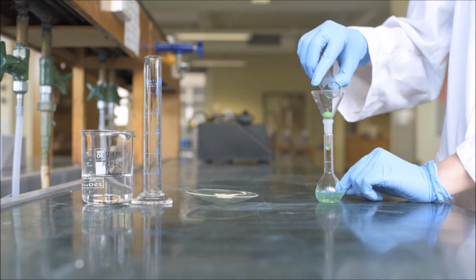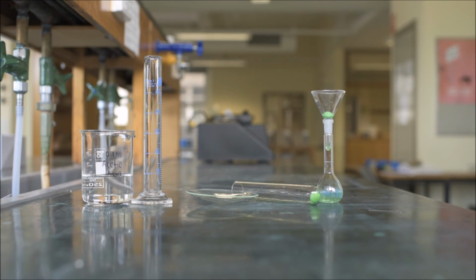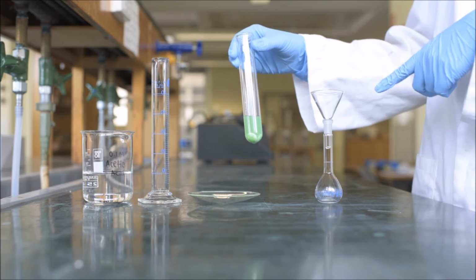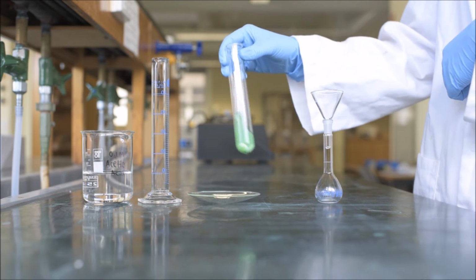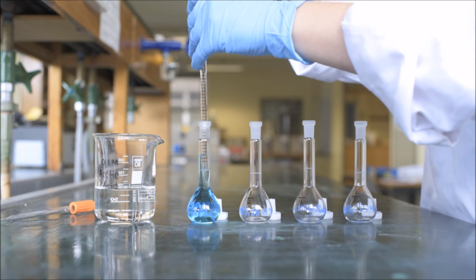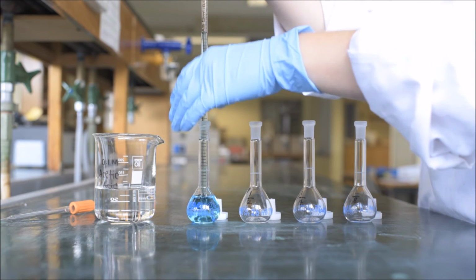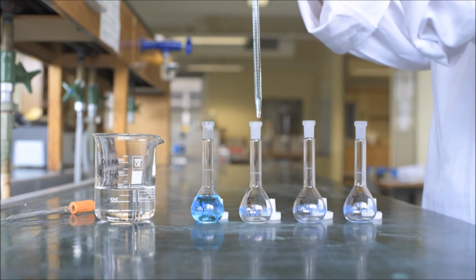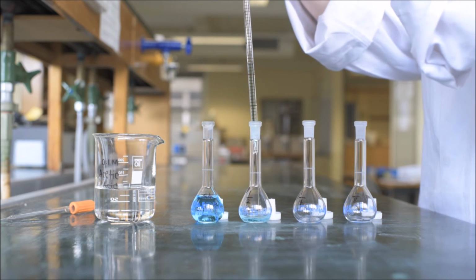If you leave your M&Ms in the acetic acid for too long, your solution will become cloudy and you have to start again. Record the absorption spectrum of your solution, remembering to blank the instrument with 0.1 molar acetic acid. You will then prepare your standard solutions of the dyes you have found in your M&M. Take the stock solution and dilute it by 1/2, 1/4 and 1/8.